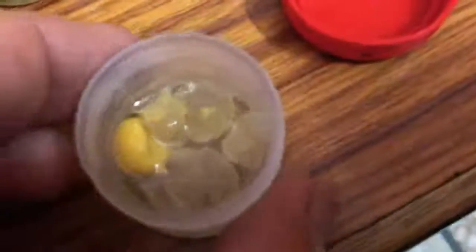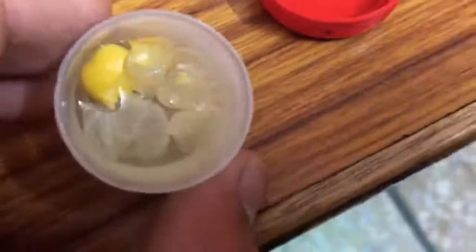Here I have just kept the outer shell of the horse gram and half horse gram which has been crushed and kept in the paste. Probably I will inoculate it with some of this pond water and see what I can get out of it. The present amoeba was from this culture. Yes, sir, sugar is also here.